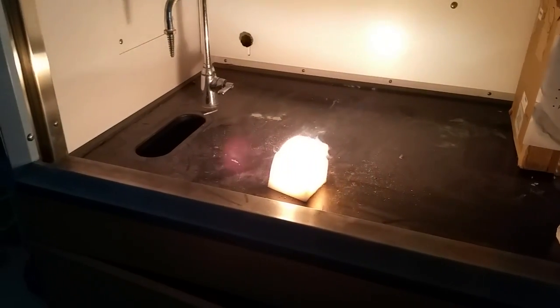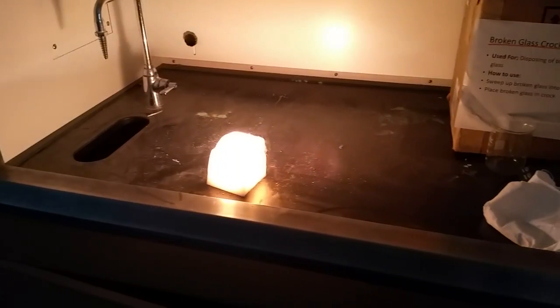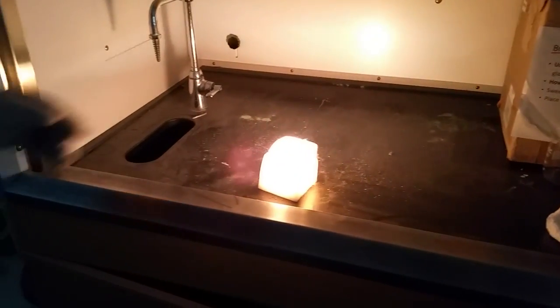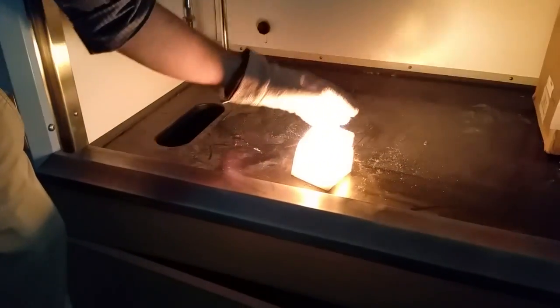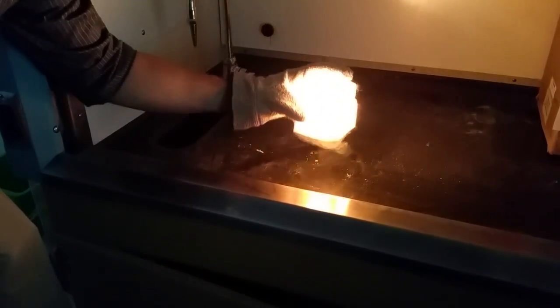Yeah. What? Don't come in here and blow it out. You're usually calm, you know? It's actually causing a lens flare. Oh yeah, it's frickin bright. It's dry ice. It's still going. What? It is still going.